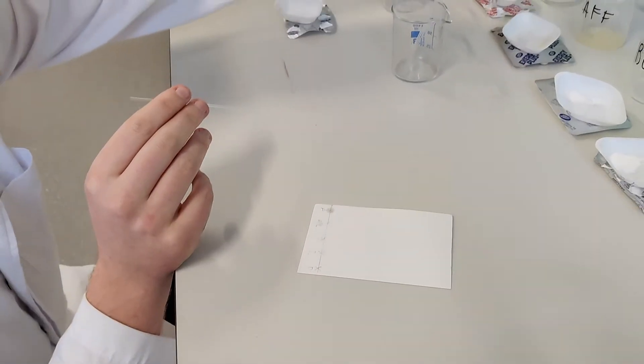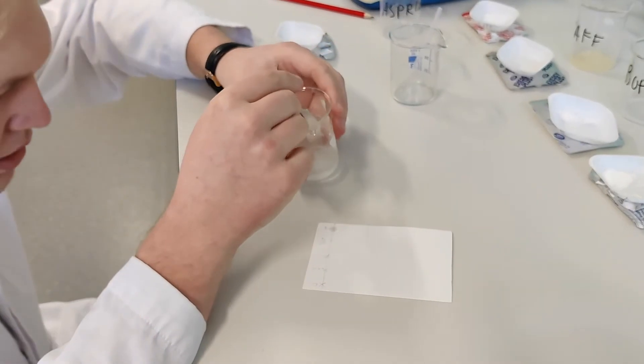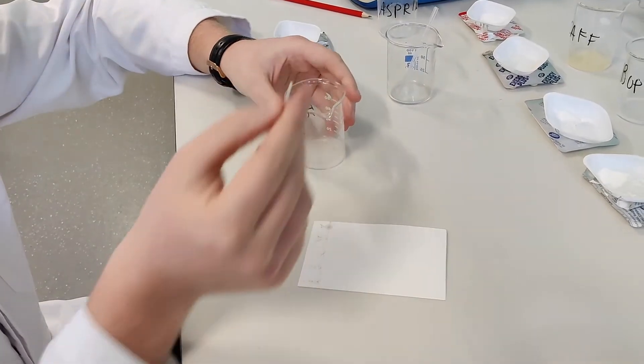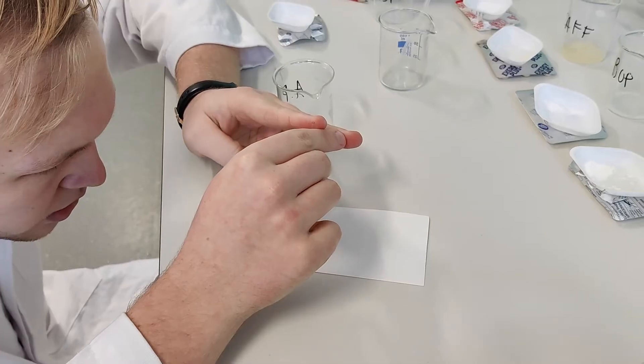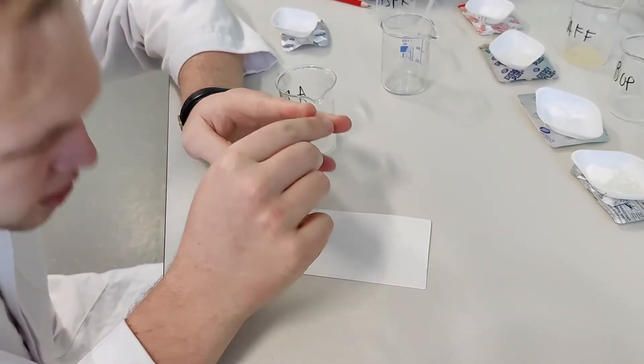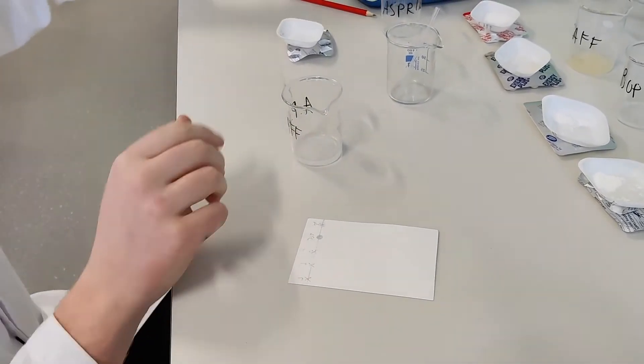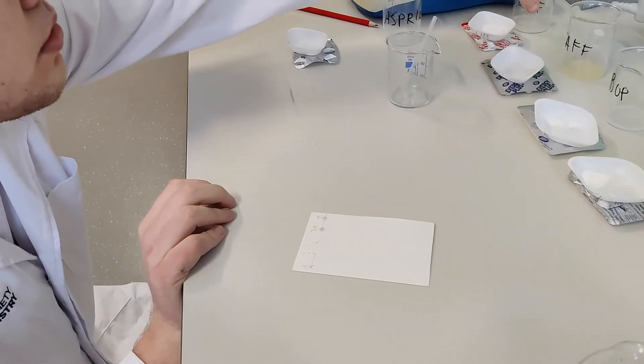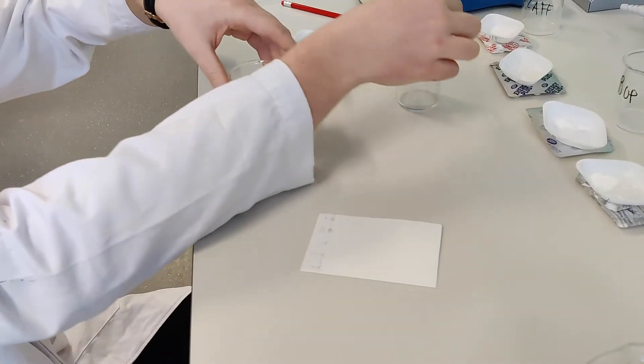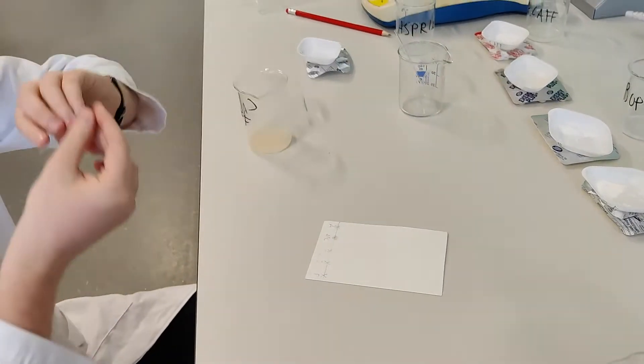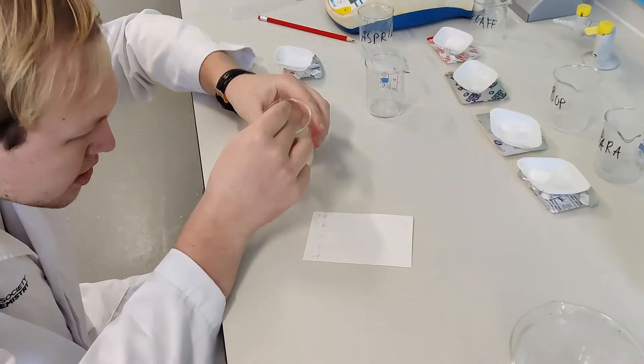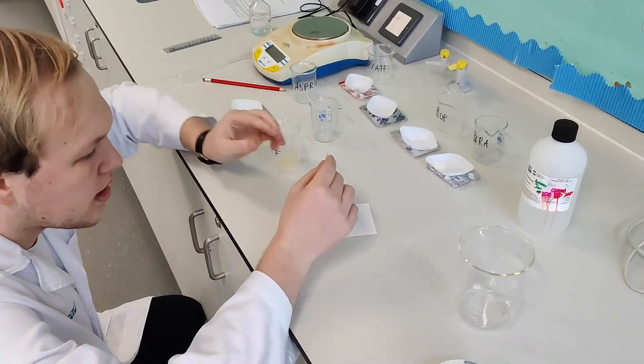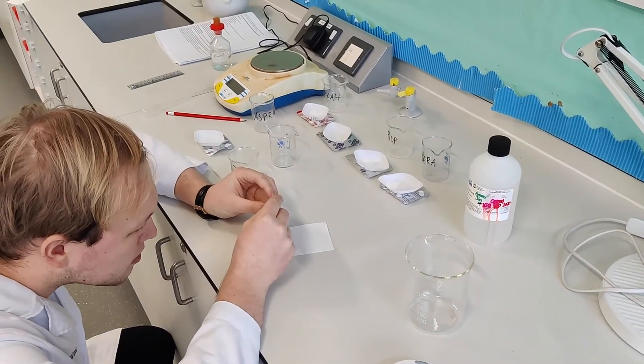Next one, we've got a mixture of aspirin, paracetamol and caffeine. Again, this has been taken up. Small dot on the line. Again, doing stuff like this, it needs to have a nice method to it. You don't want lots of different things cluttered all around. You want to have a nice system that you're using. Not a cluttered system.